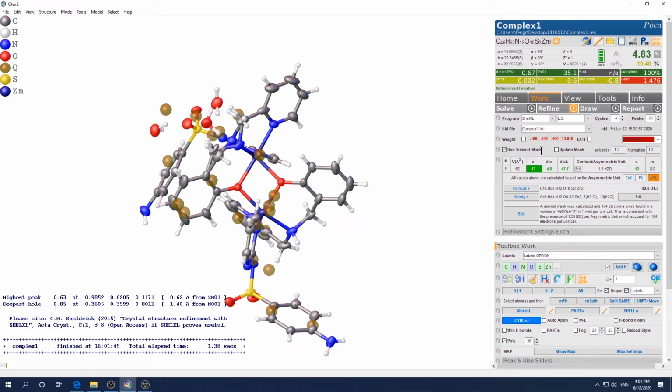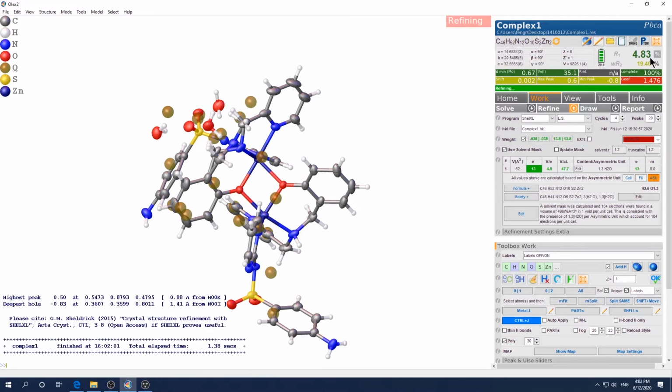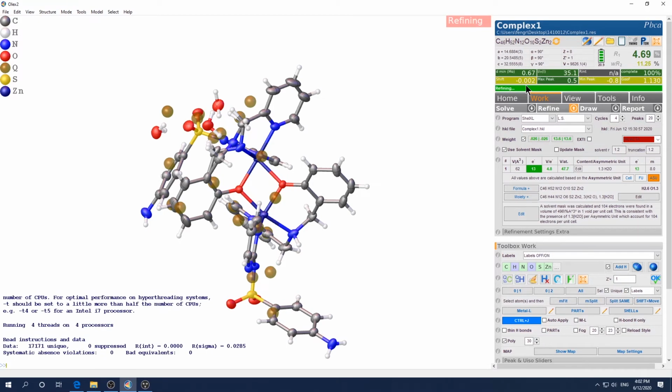And now it's time to check this button to let the program update the weight and take the weight into account during the refinement process. Okay, just click refine, watch this number will drop again at this number too. See? Magic. All of a sudden it dropped all deep green. Perfect. Other than here, let's just refine a little bit more. A little bit more. Okay, good.